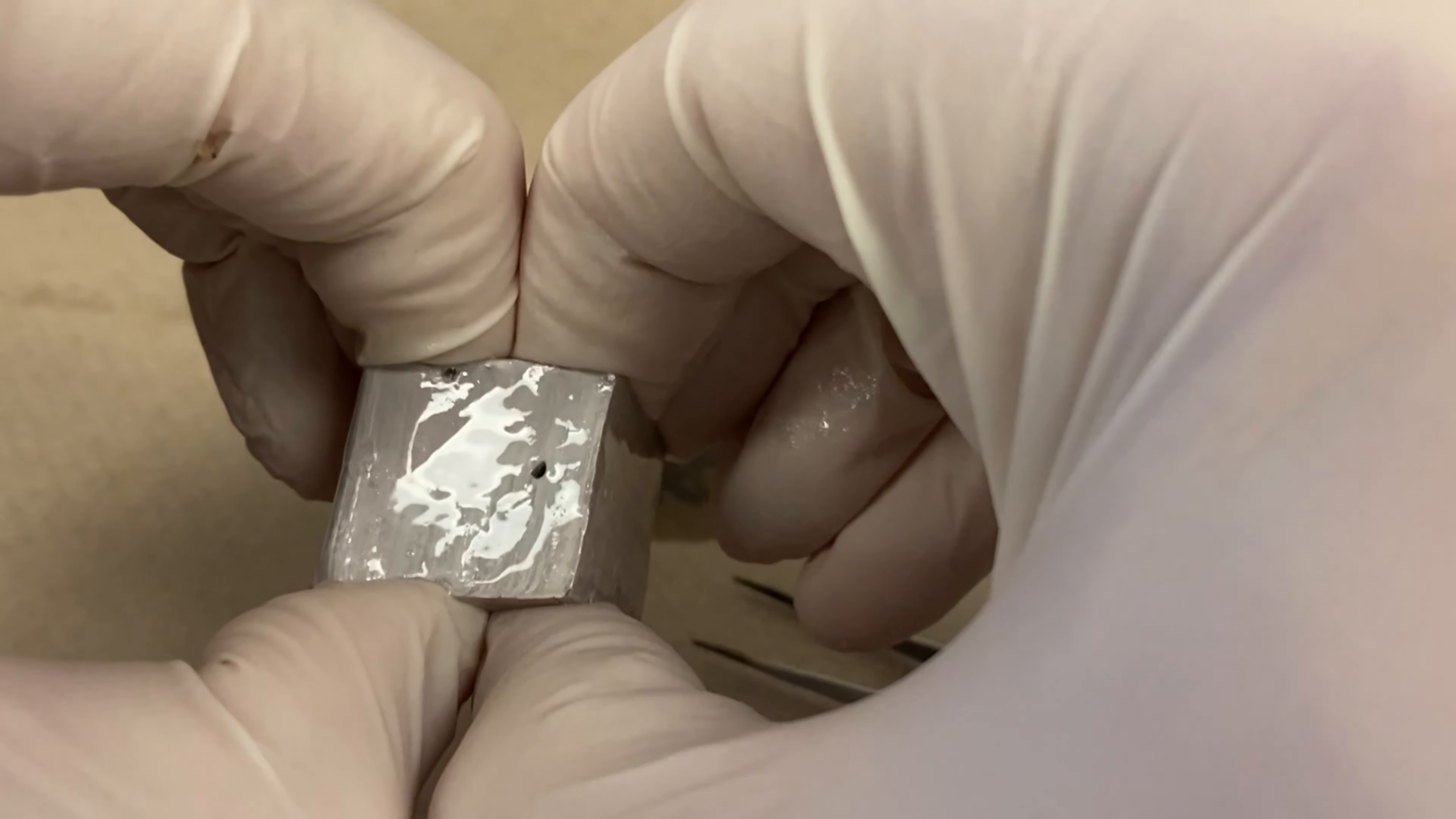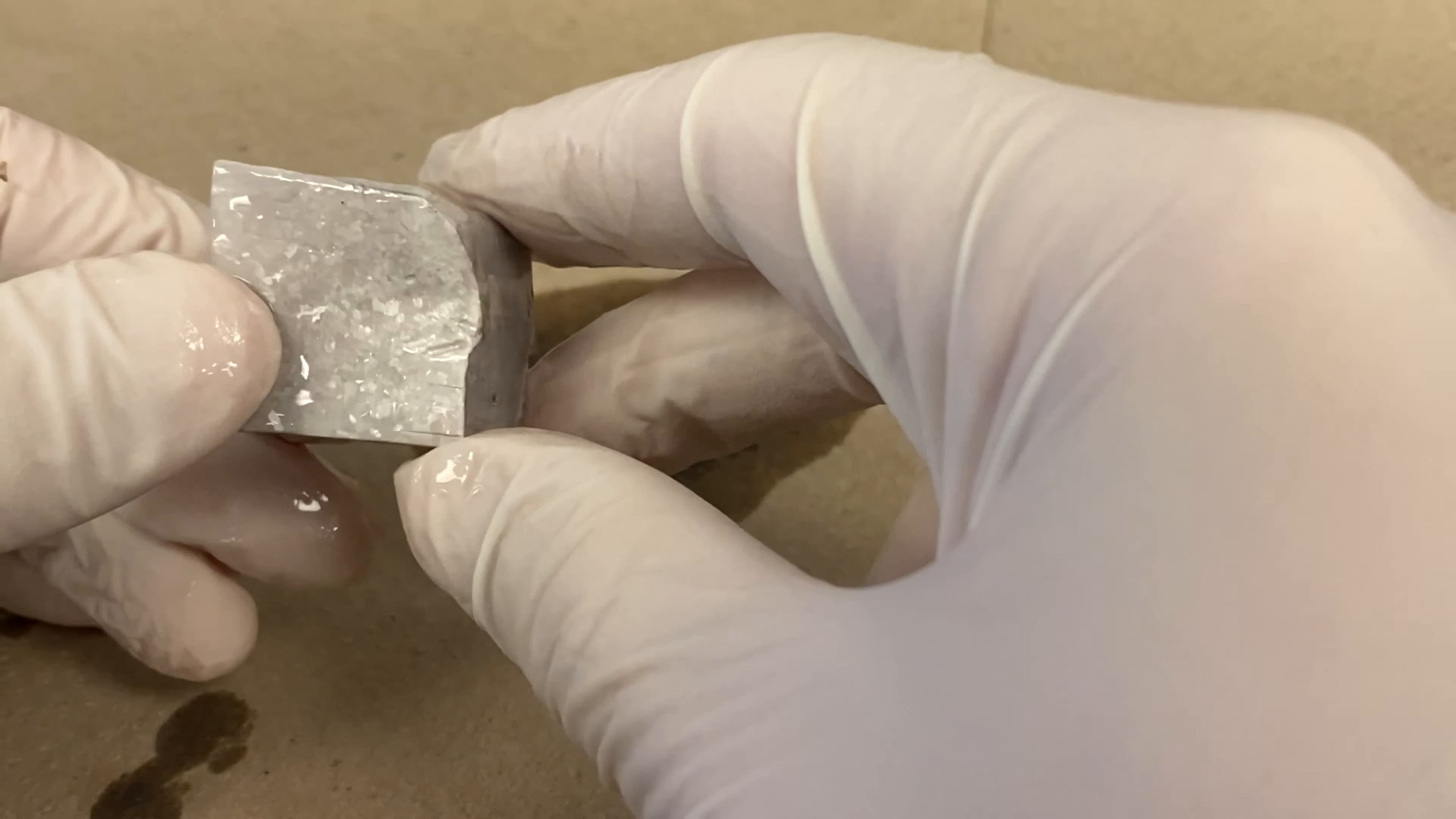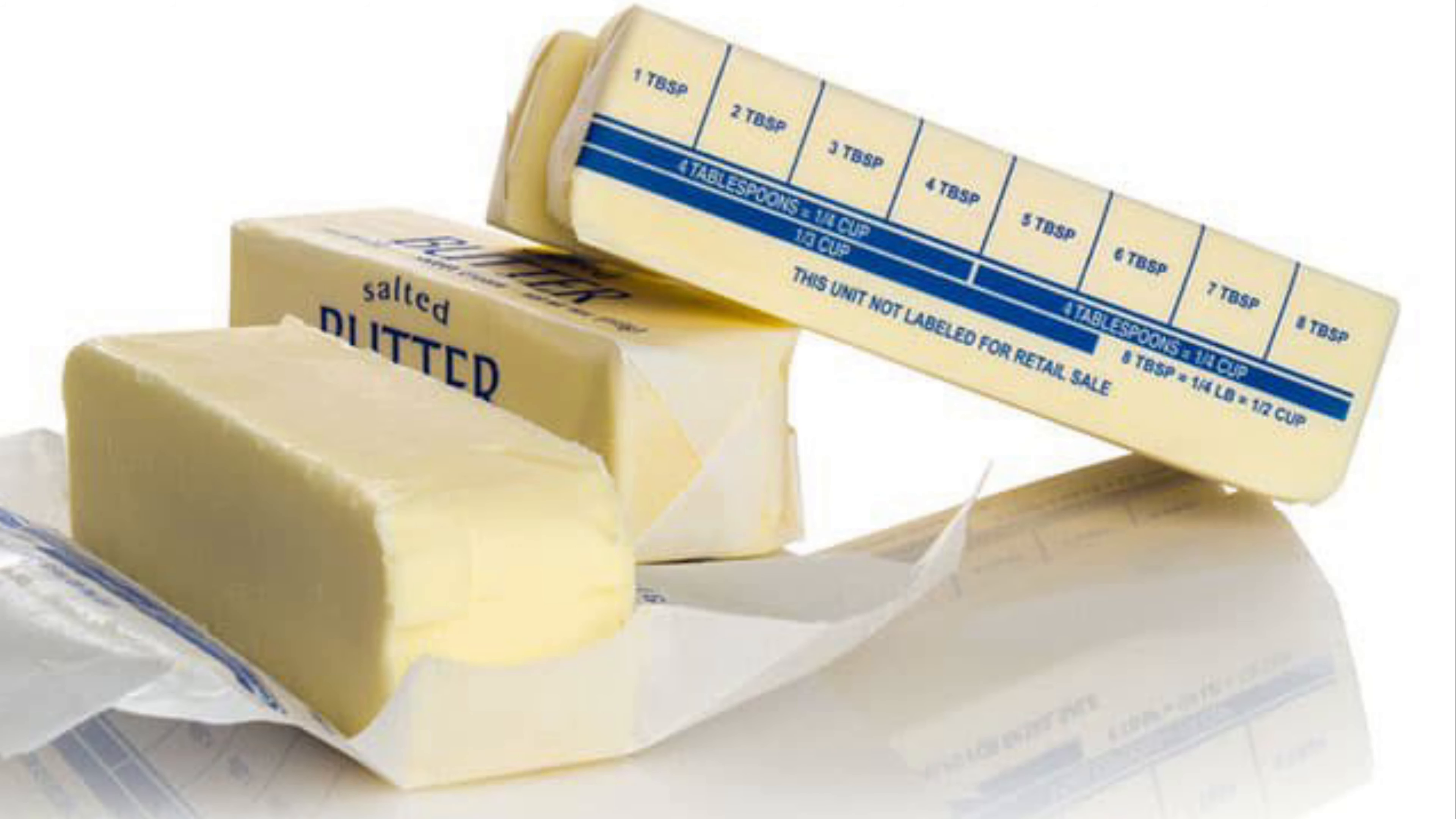Now, it's really soft. When I'm feeling it and squeezing it here, I can put a little pressure. And look at it. I can kind of squeeze it almost like really hard putty. Actually, the texture of this thing feels as though I'm holding like an eraser or something like that. You know how erasers kind of have a little bit of give to them? It's a little softer than that, but it kind of feels similar. Maybe like a hard stick of butter after you've just gotten it out of the fridge and it's cold. This isn't cold, but when it's still cold, butter is kind of hard, but it's also kind of soft in that you can kind of squeeze it and manipulate it.